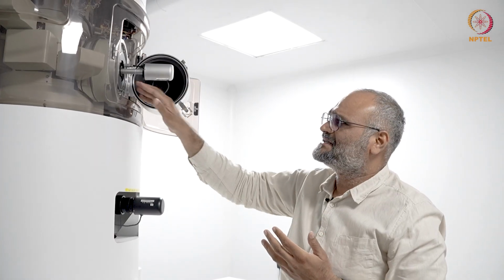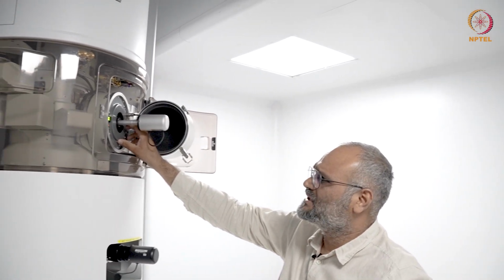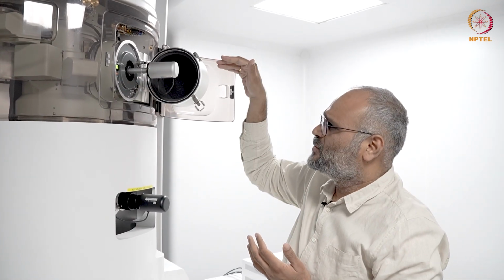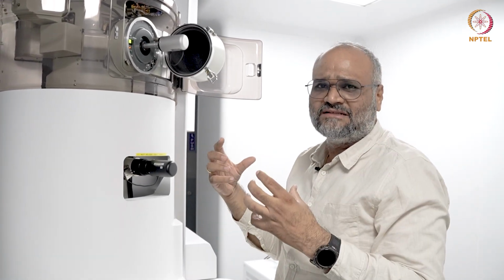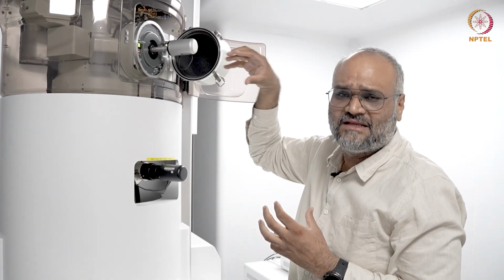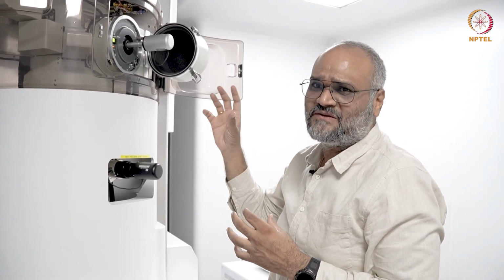So the holder is resting here on the first O-ring, and it is getting evacuated around the first O-ring right now. Once it shows that it is holder ready, once it goes in, as the column is under ultra high vacuum, there's a good chance that the holder gets pulled in. So please be very careful that you hold this and the holder doesn't crash into the microscope. The risk, if it does crash in, is you might actually hit the pole piece or something in between, and you can cause irreparable damage. So please be careful with this.